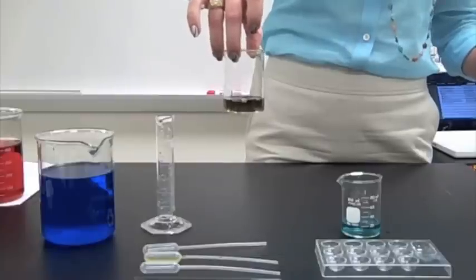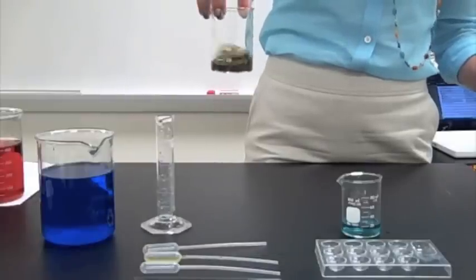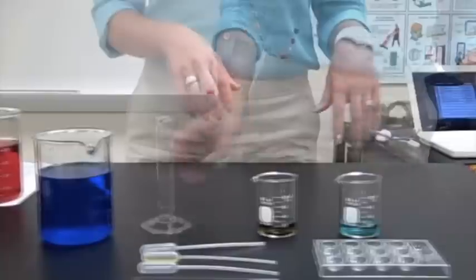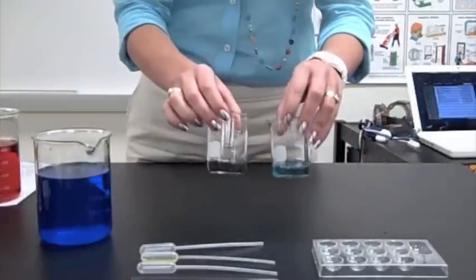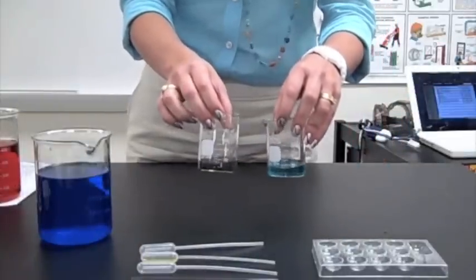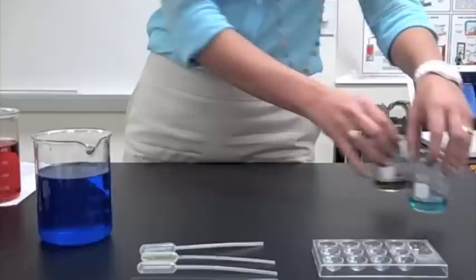And there you go. Yes, I'm an Aggie. Yes, that's maroon. That's why I picked it. Hopefully your color matches something along these lines. Part one of the lab is done. Hopefully, your colors have matched up pretty well with mine. It shows that you have good liquid measuring and transfer techniques.